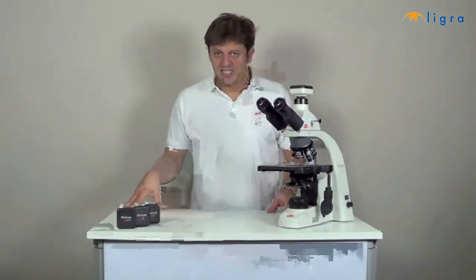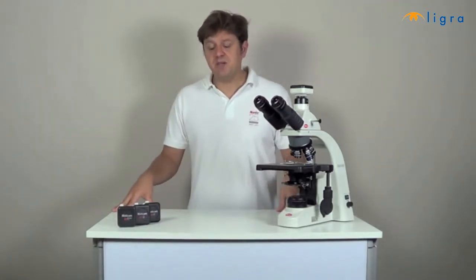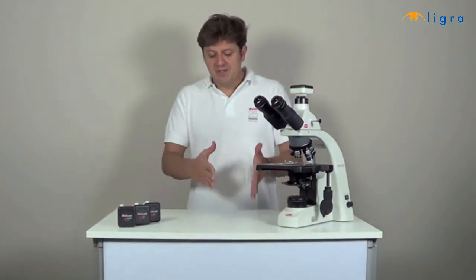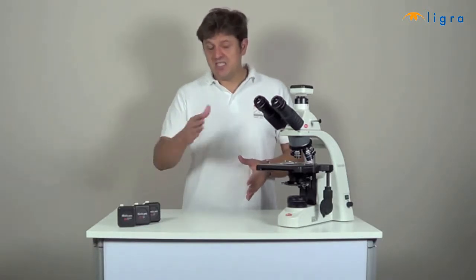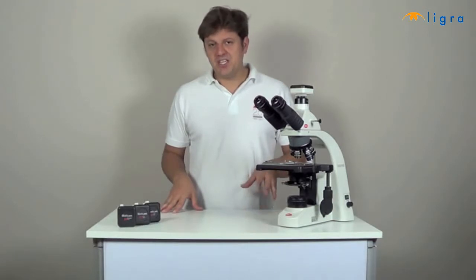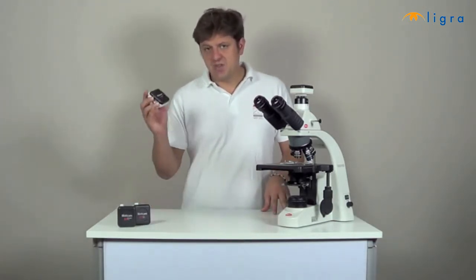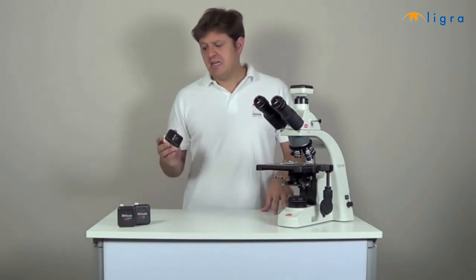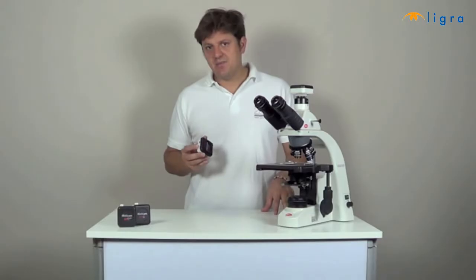Moticam 1SP has a resolution of 1.3 megapixels. More than twice as much as the Moticam 1, and the advantage of this model is that most laptop screens also have a resolution of 1.3 megapixels, and this means that the whole image is completely displayed on the screen, and it's a very popular model in the education sector. And Moticam 2 has a resolution of 2 megapixels, so in this group it is the camera that gives you most details.